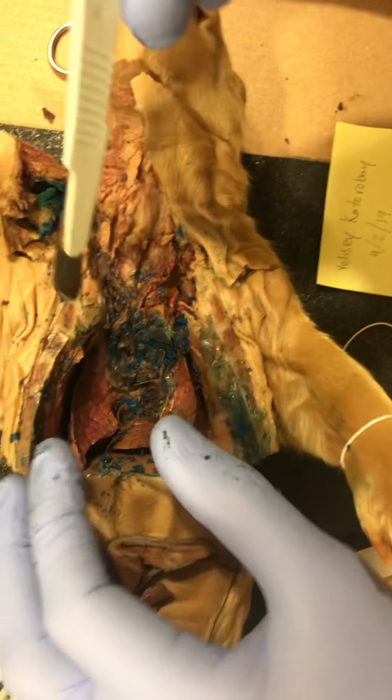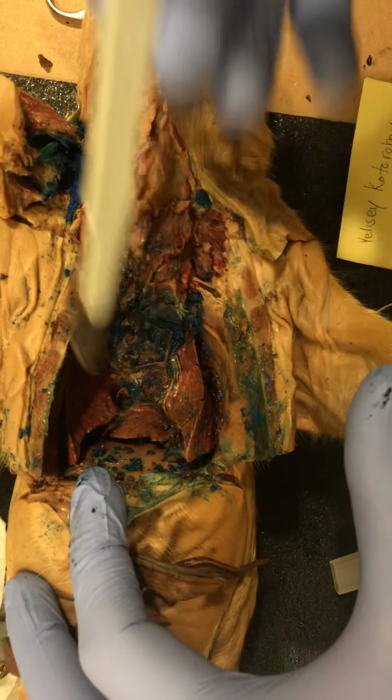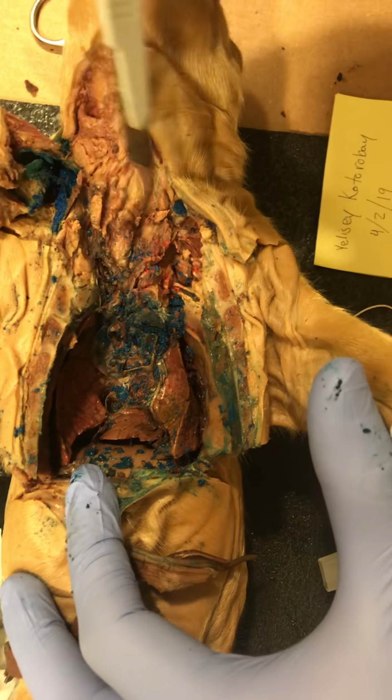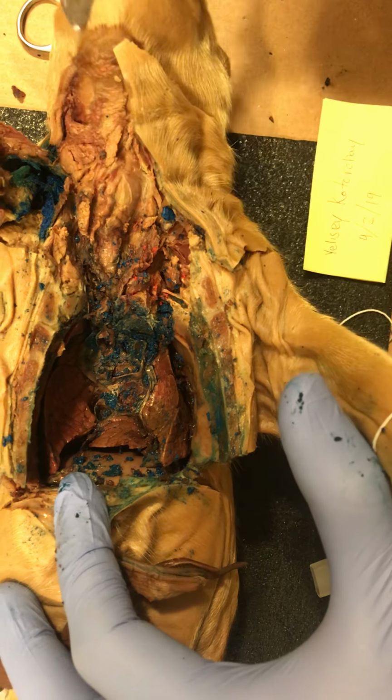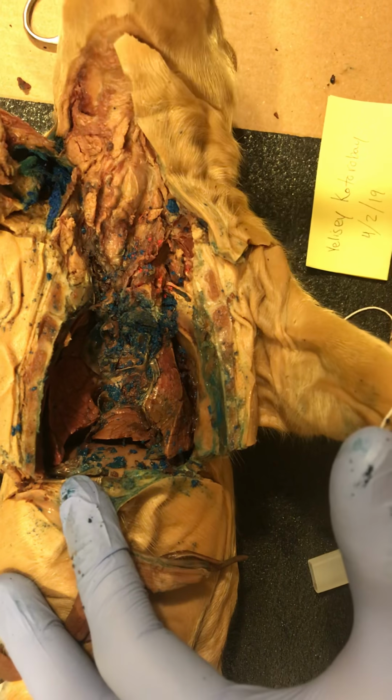The reason for that name is because of their close proximity to the diaphragm, which you can see one more time right here. And if we work back upwards, we've got the trachea, the larynx, and the various structures in the throat, finally connecting us to the mouth. And that concludes the video.